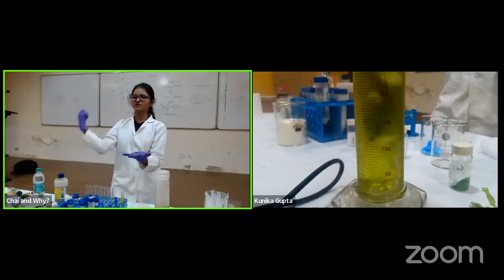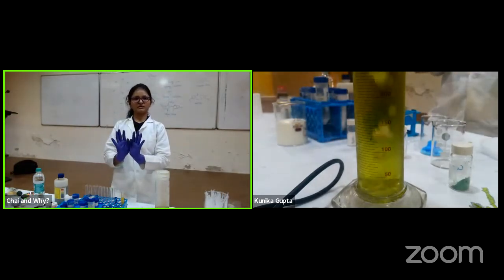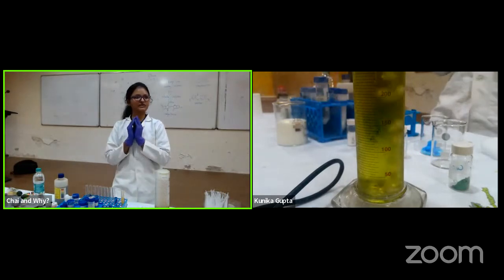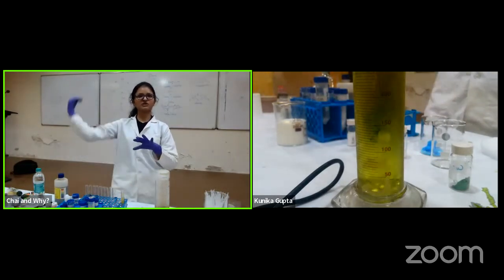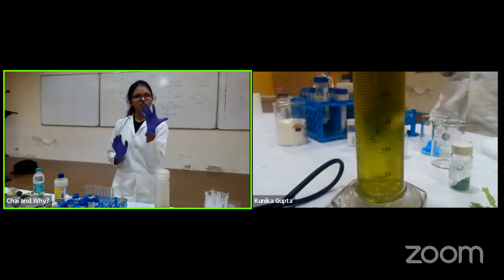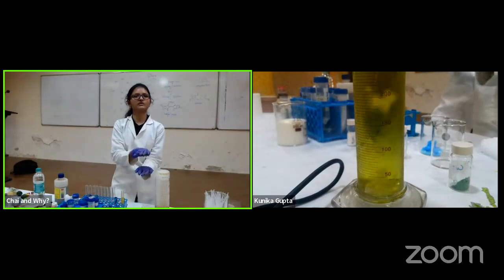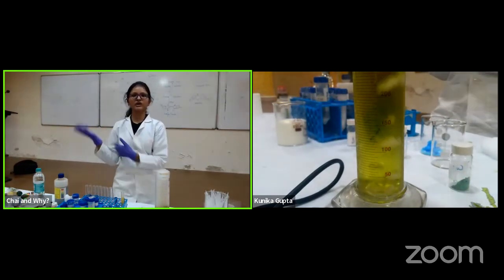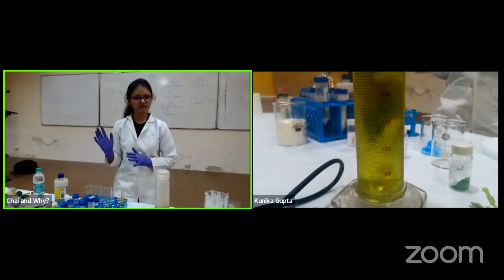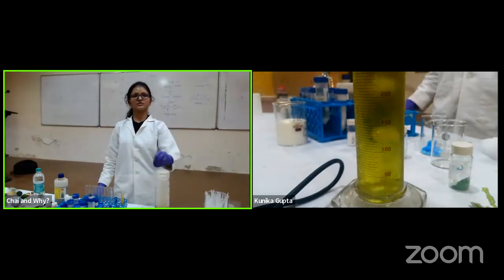The carbon dioxide enters the incubator. The incubator is just like a fridge kept at the temperature at which the cells will survive. So it's just a fridge with a carbon dioxide pipe going inside. There is water, there is carbon dioxide, and it will maintain the pH at 7.4. How it is maintained, I can control with the amount of CO2 I am supplying. So this is a practical application of what I have done from a basic experiment.